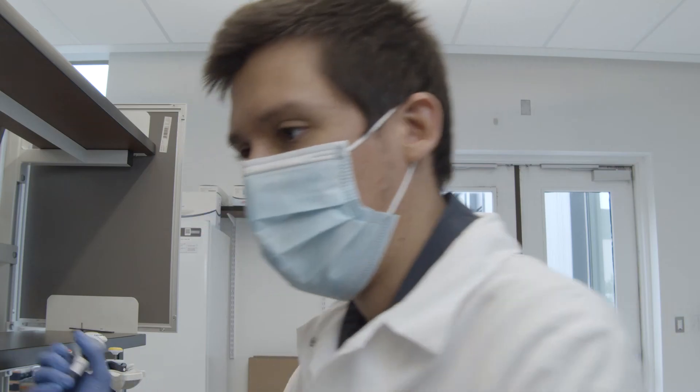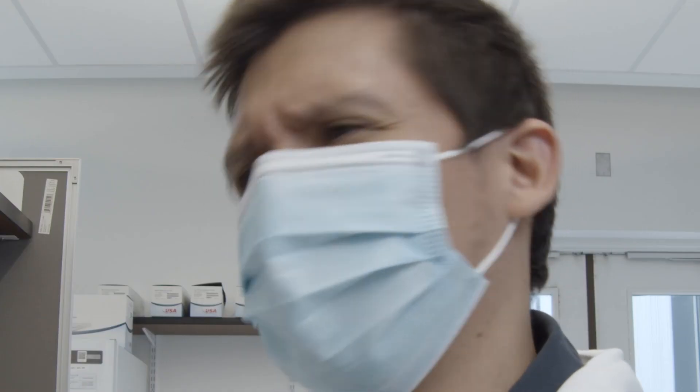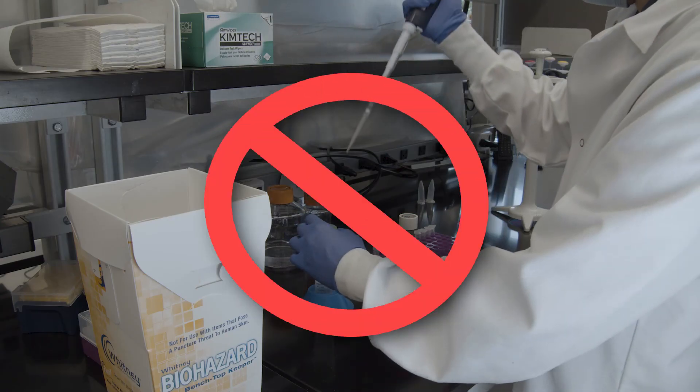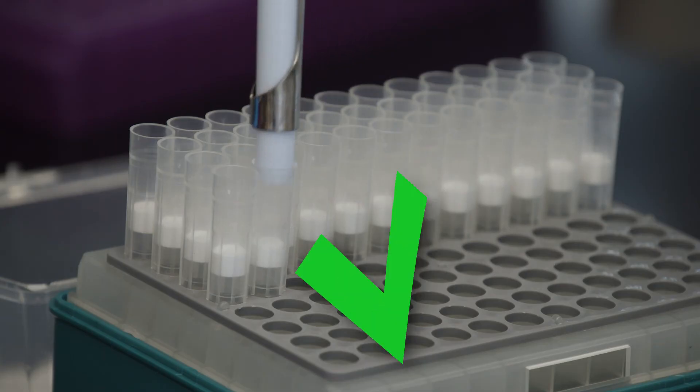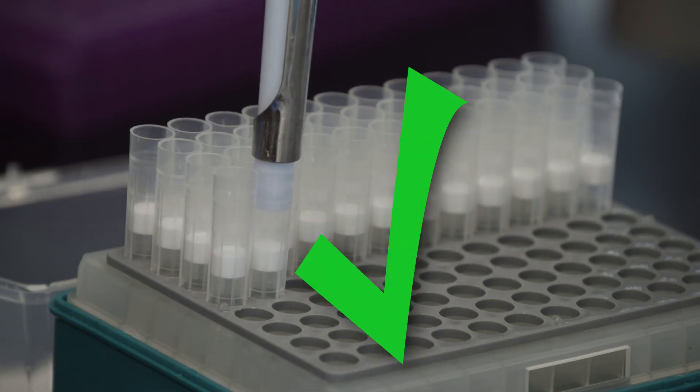Remember, never reuse pipette tips. Reusing tips could lead to contamination or inaccurate liquid amounts. Always use a fresh tip when you're pipetting liquid.